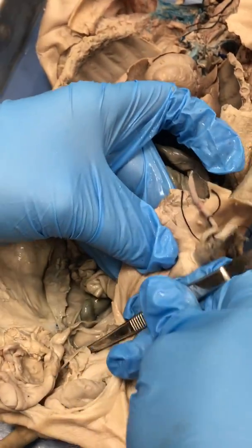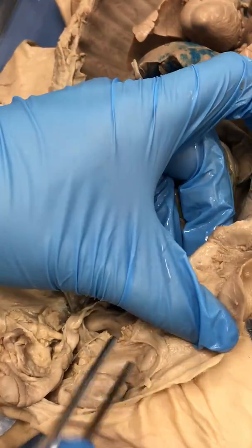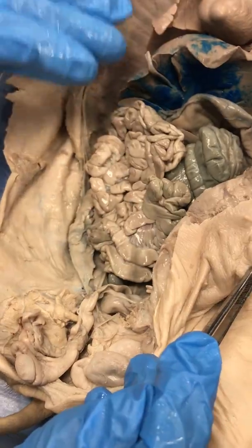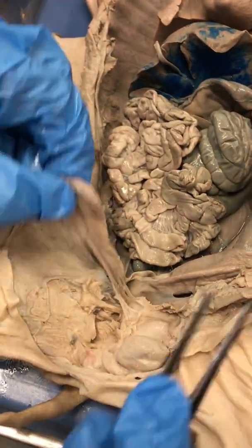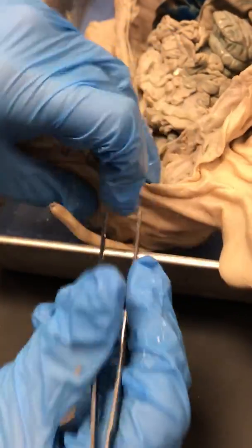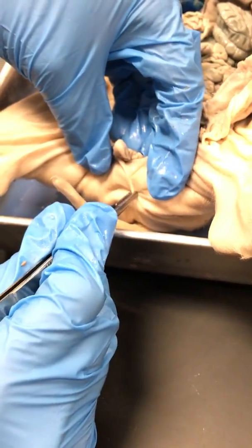Okay, so the urethra comes out through the pelvis and goes around. You can actually see part of the base of the penis right there, and it's going to come out there. So that's the only big difference on the urinary tract in the male. The male reproductive tract, this is a testicle that's been fully dissected. Here is a testicle that was not dissected. Both of these testicles used to be encased in this sac right here, which is called the scrotum.